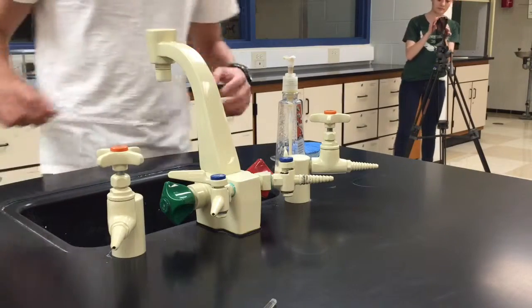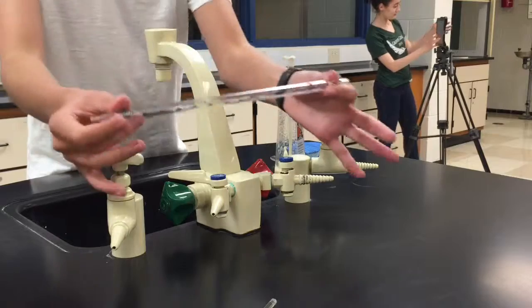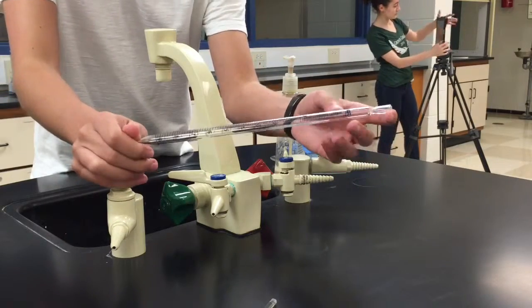All right, so this is the tutorial for pipetting. First, you're going to need a glass pipette, something like this.